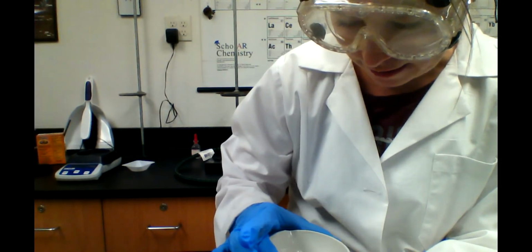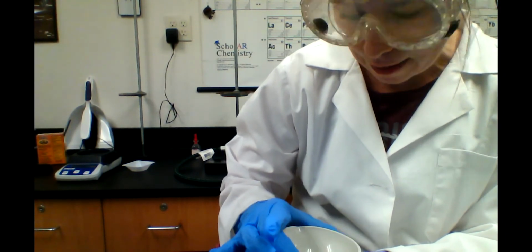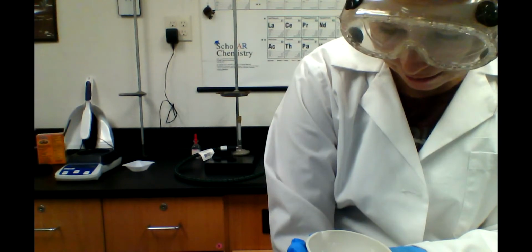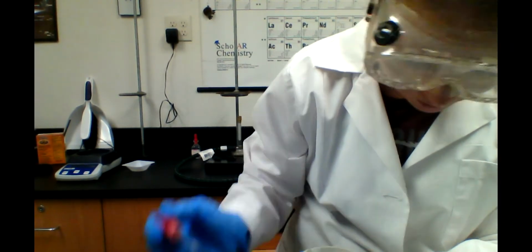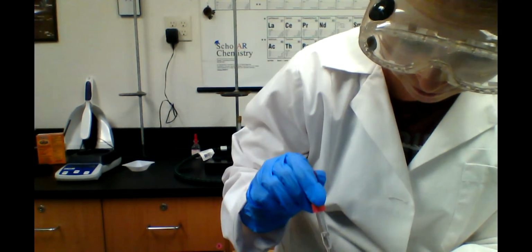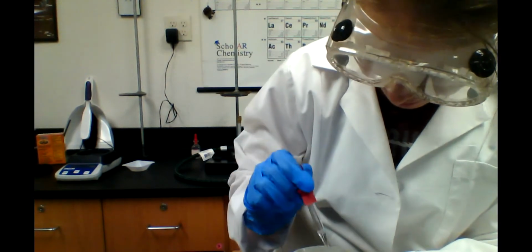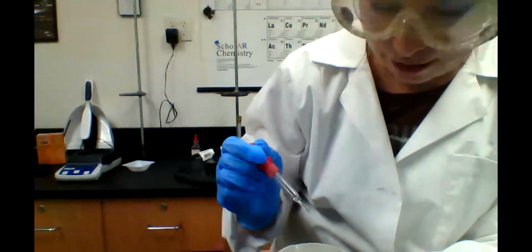Make sure the acid can get to the baking soda that's in the center, because if it's in one big lump, then even if there is acid in there that hasn't reacted, it can't get into the baking soda. Okay, is that just a little bit more? Okay, I don't see any more baking soda, but if I add acid, there's a little bit more bubbling going on, so we're not quite done.